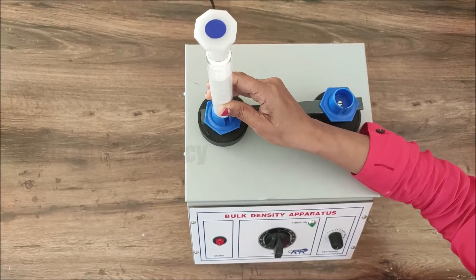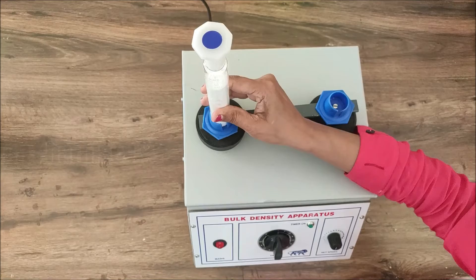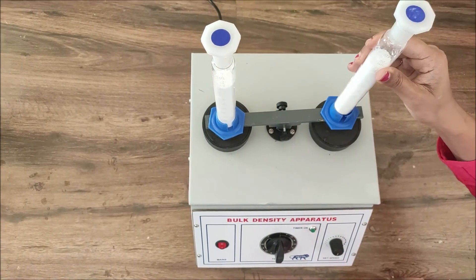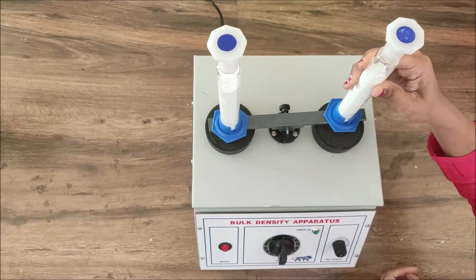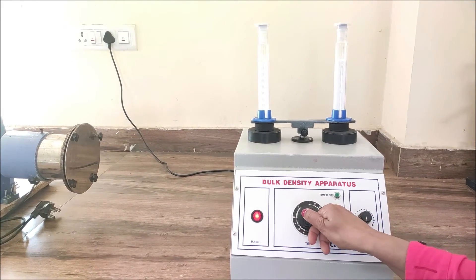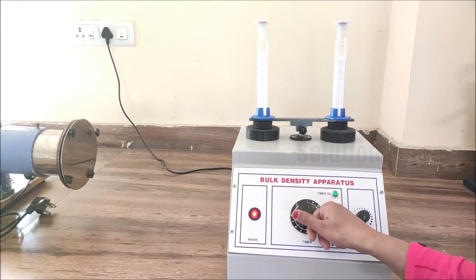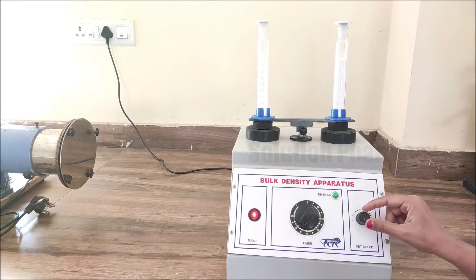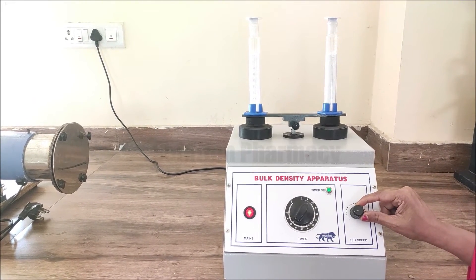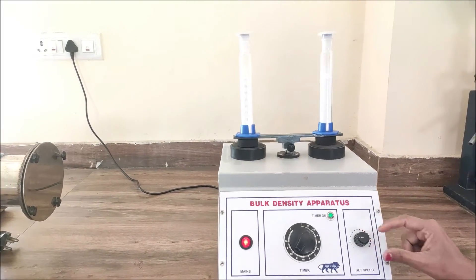Then fix both measuring cylinders containing powder, one by one, properly into the holder on the top of the bulk density apparatus. After this, adjust the timer knob and speed control knob for 125 tappings — first we set the apparatus for 125 tappings — and you can see that when we have set the timer and speed, the tapping starts.